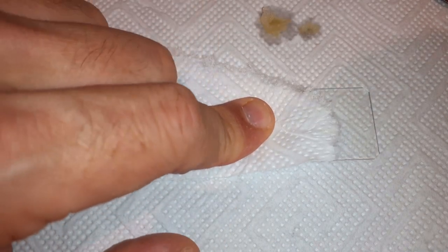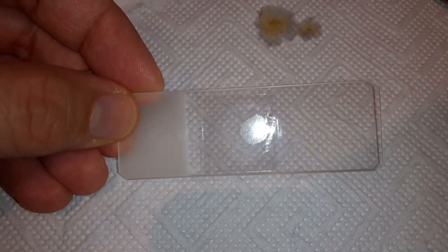Another possibility would be to squash the specimen. This is only possible if it's sufficiently soft, and it separates the cells, though it can introduce artifacts by damaging the original arrangement of cells. Or another way, for example, would be to polish the specimen — if you have a rock you'd like to observe using polarizing microscopy, you have to polish it because you can't cut a rock. There are a variety of different ways, but you first have to get the specimen small enough to fit it on the microscope slide.